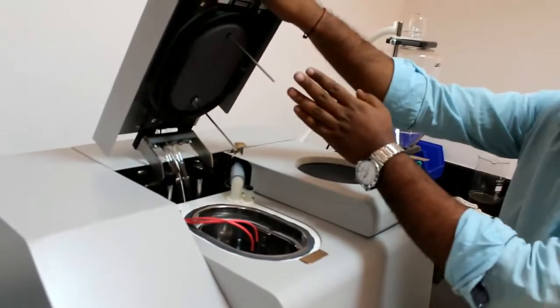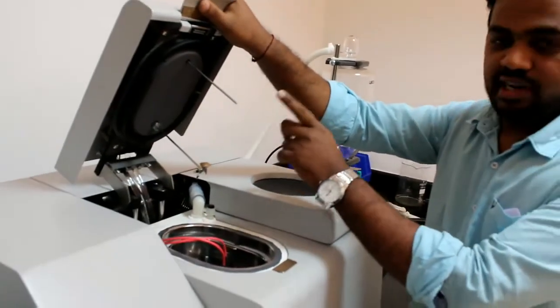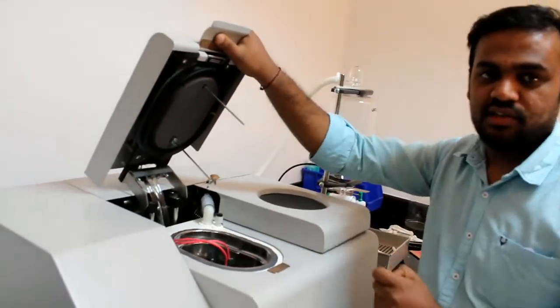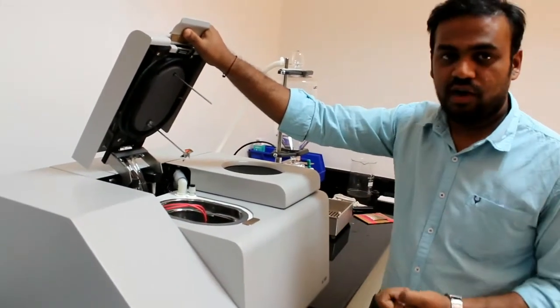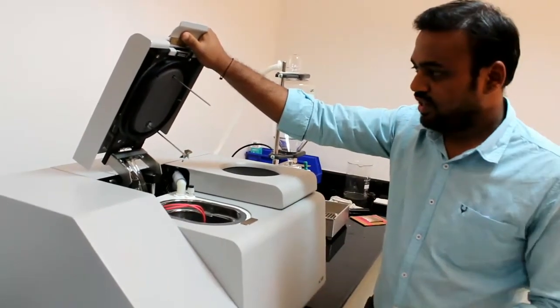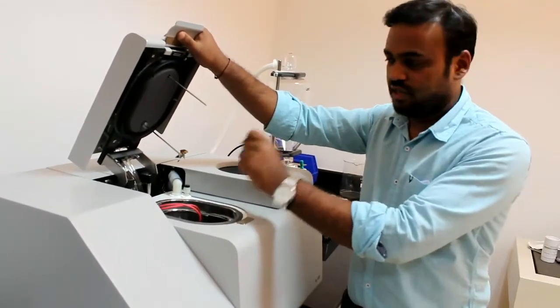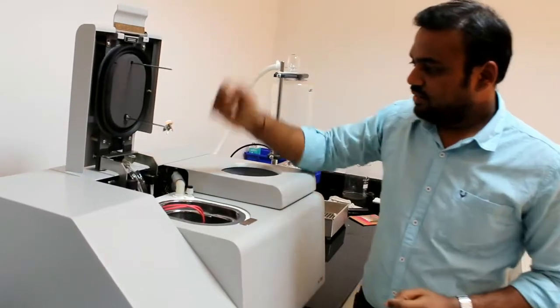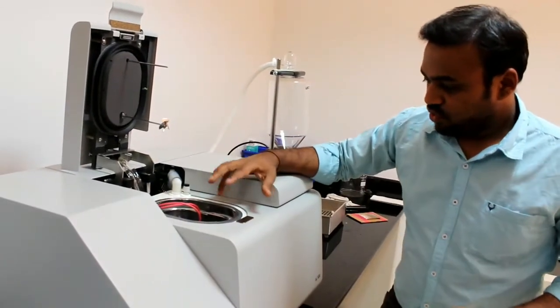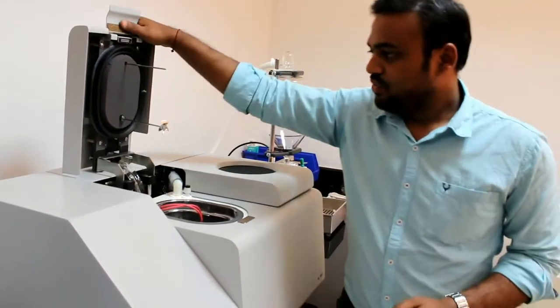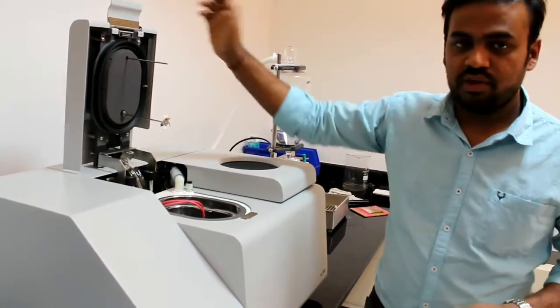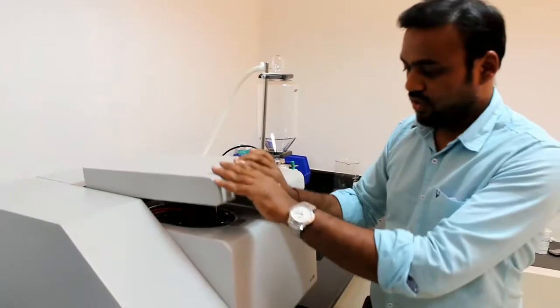We have thermistor, high precision thermistor. This is 1 by 10,000 degree Celsius of high precision. So every 6 seconds it traces the temperature of the water and sends to the microprocessor, so that it is every time monitoring the temperature of the water. And this is the stirrer, to uniform temperature maintained within the bucket, we use this stirrer. Once we give analyze, the stirrer will be rotated and this will start working. Now we will close the lid.